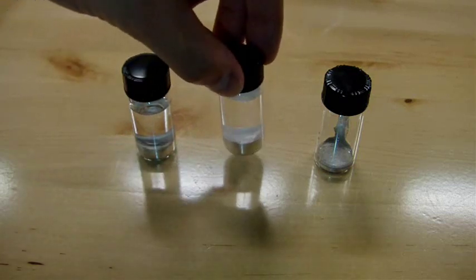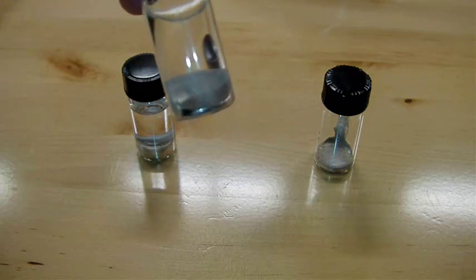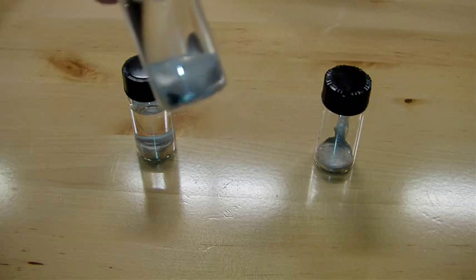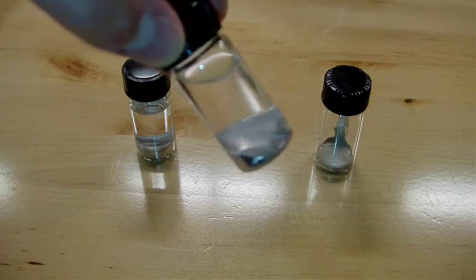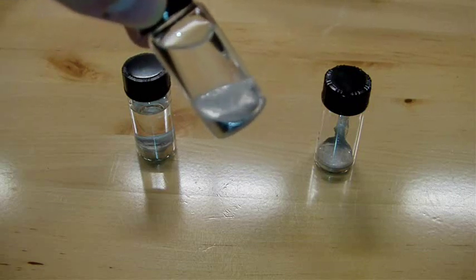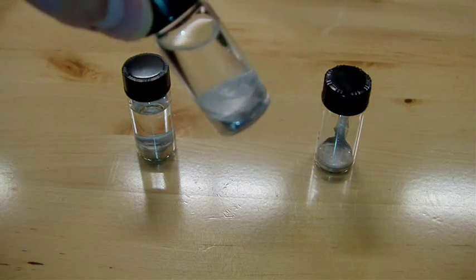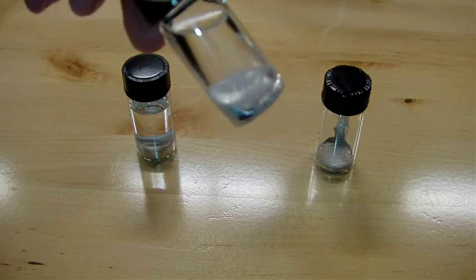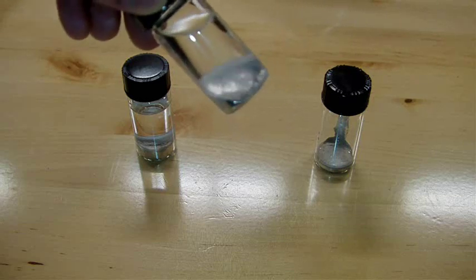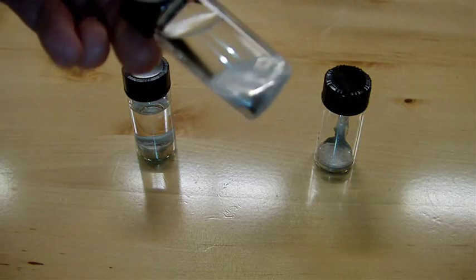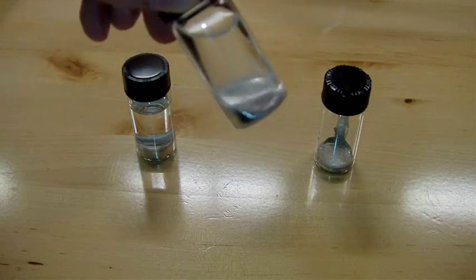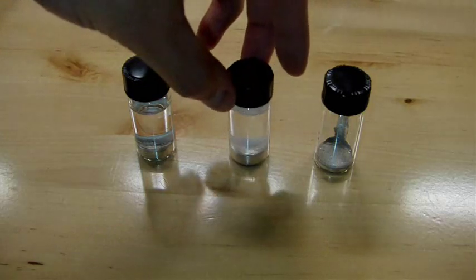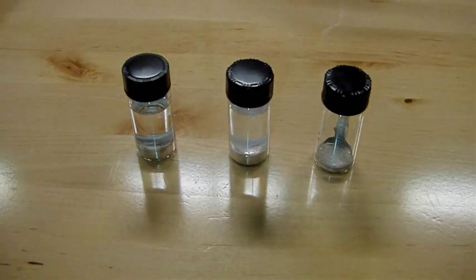The next one is water, which doesn't look like it held up as well. It might be a little hard to see on the video, but it looks a bit cloudy. So it looks like it's sort of attacking the surface of the liquid. But interestingly, it also doesn't look like it's sticking to the edges either. So it appears that water prevents it from wetting surfaces. But it looks like it's degrading it as well.